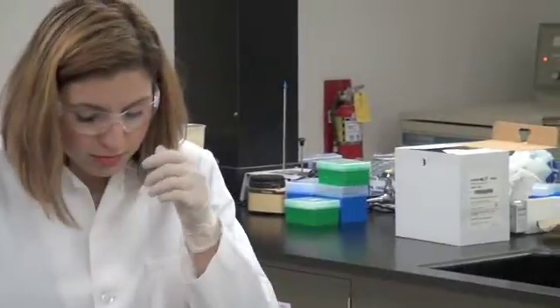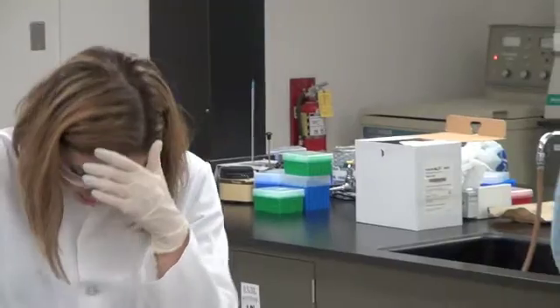With all those errors, it's not surprising she had poor enzyme recovery. She should have had similar activity to her crude, using the same dilution folds, but she likely had zero to no activity in her 40% supernatant.